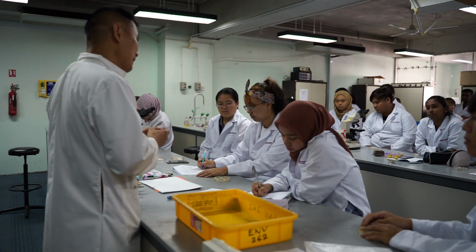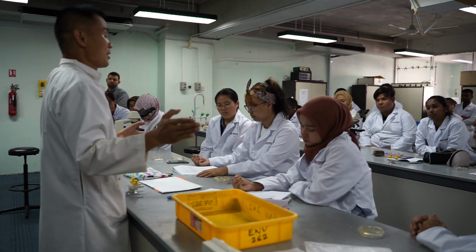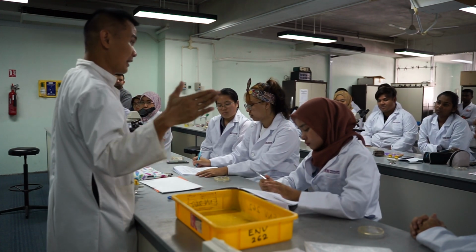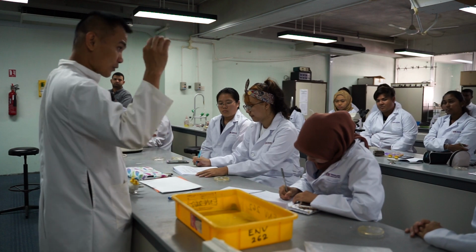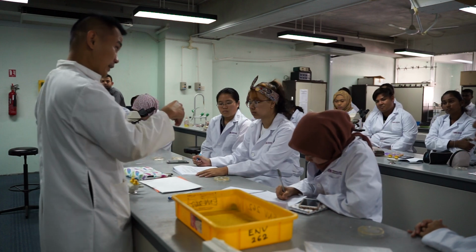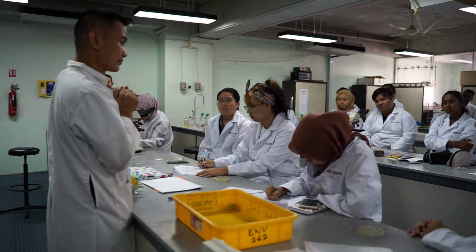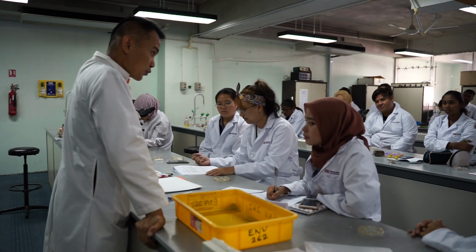What happens is that if the cell wall is thin, the alcohol is going to wash the crystal violet out. But if the cell wall is thick, the alcohol will not be able to go in and wash it out. Once you wash the color out, you're going to put safranin. If the crystal violet is still there, safranin cannot go in. But if the crystal violet is already washed by alcohol, safranin can go in. Safranin is red, crystal violet is blue. So if the cell wall is thick, what will the color be? Violet, yeah, it's blue. Safranin is red.